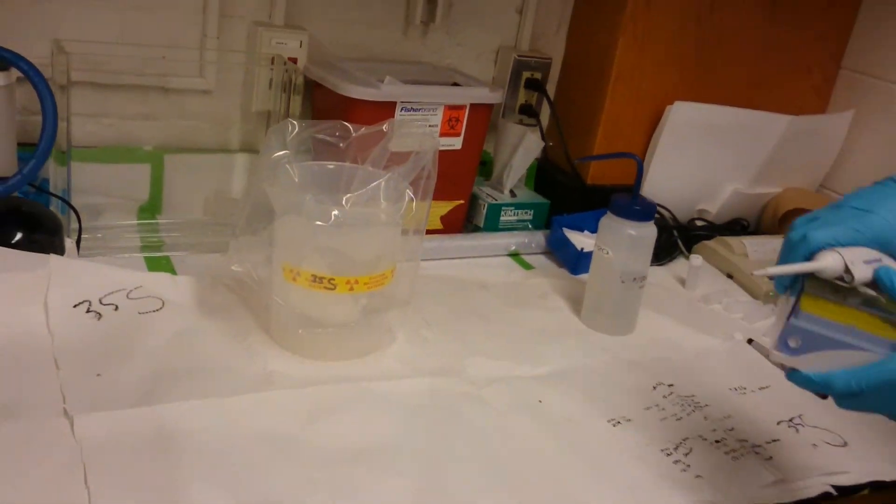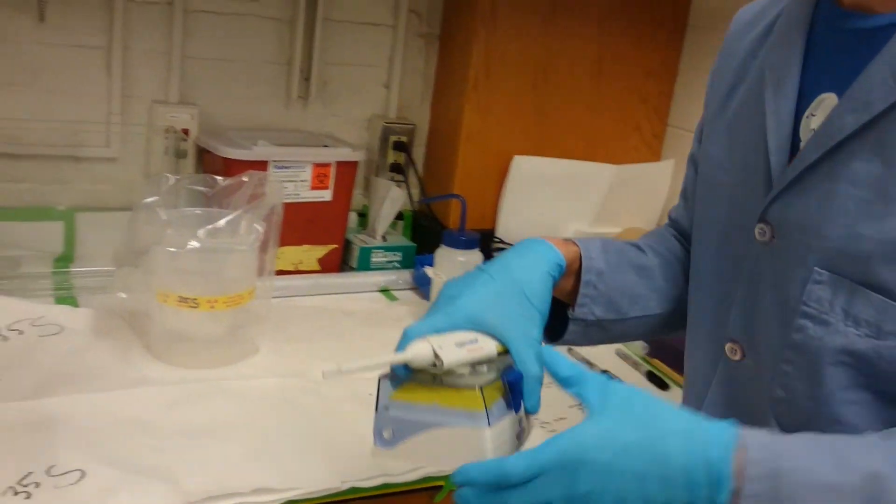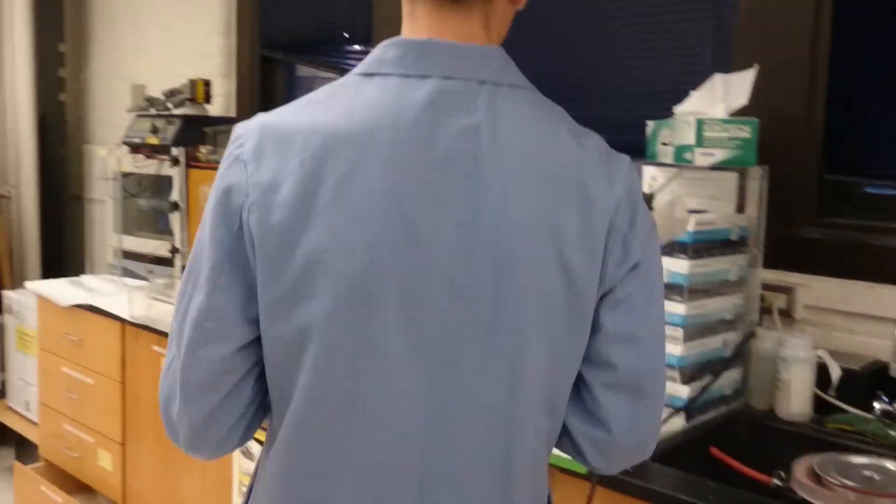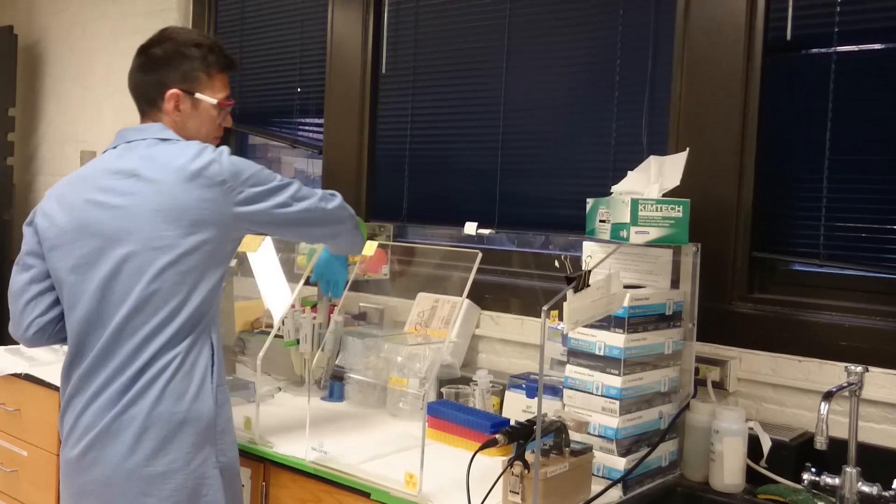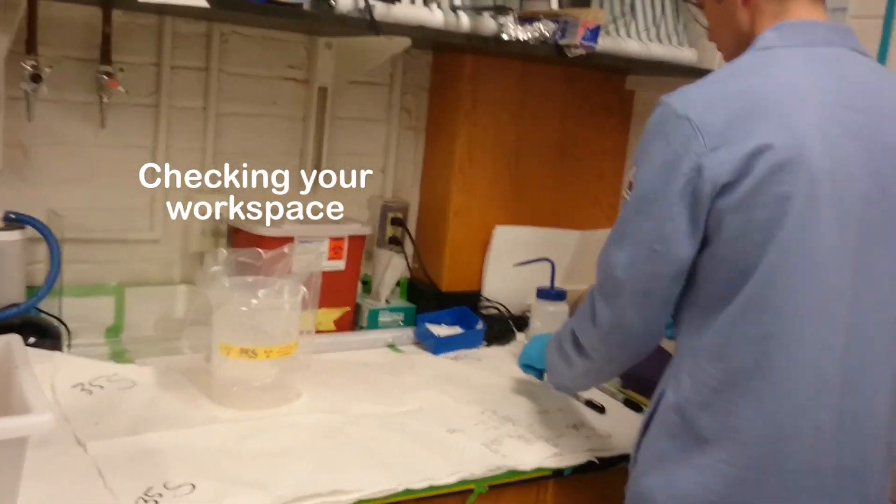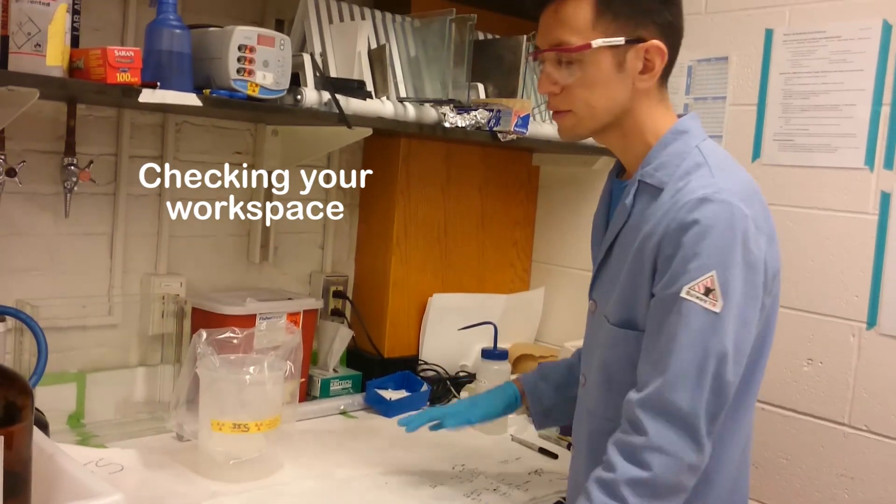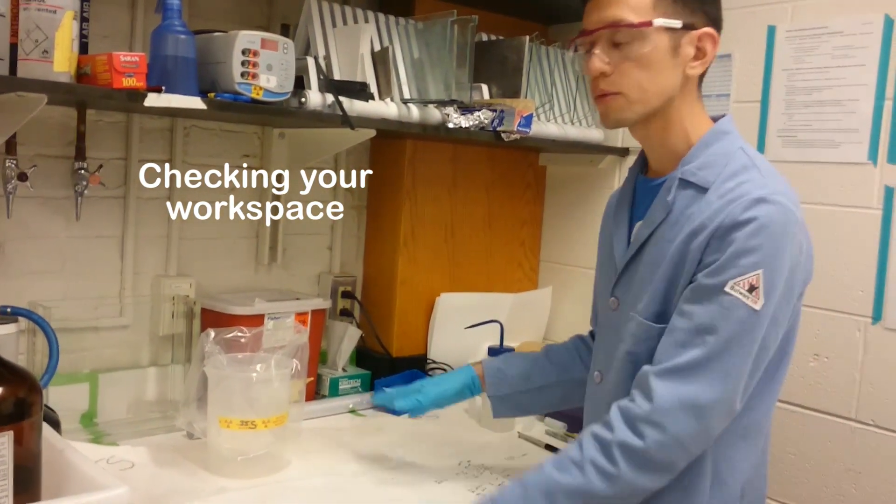At this point, I can move these off of the radioactive bench and put them somewhere else. Next, I want to show you how to check the work area.